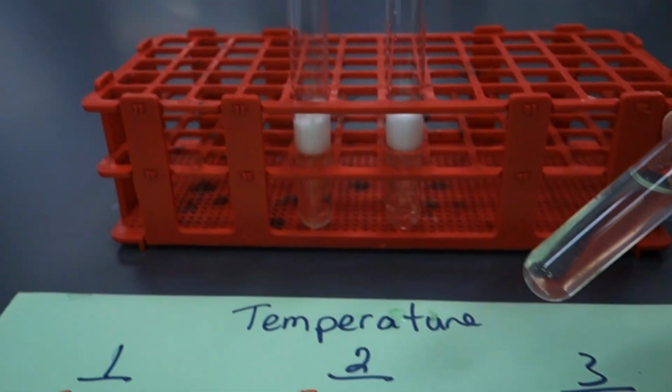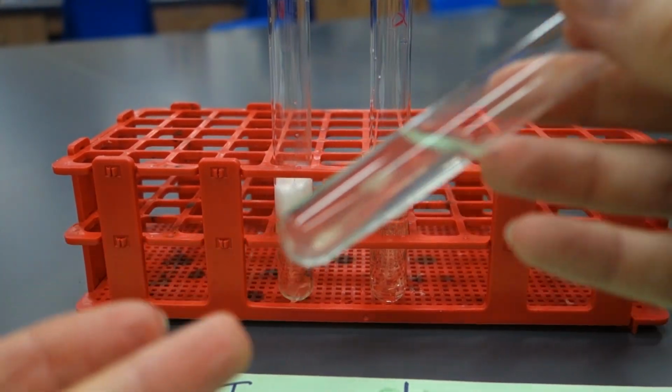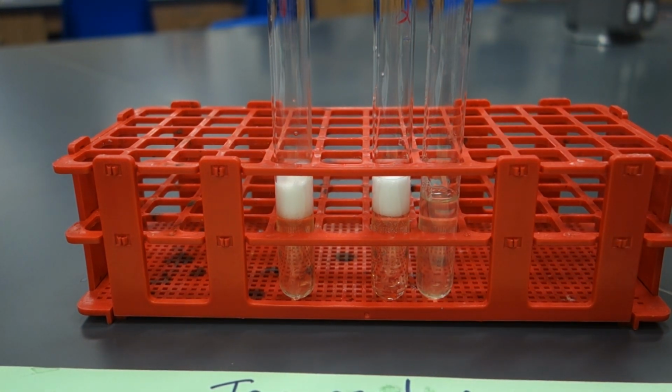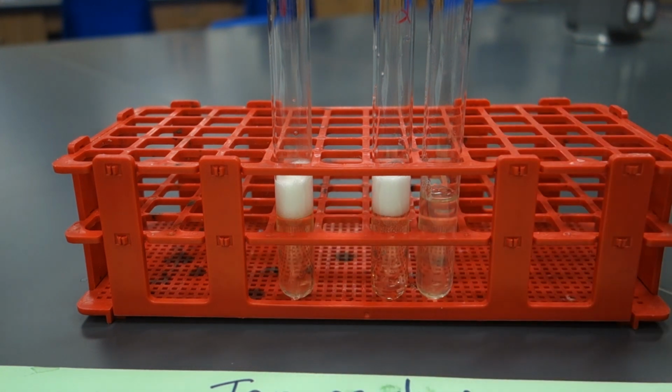So if you've got this sitting in boiling water, the structure of the enzyme physically breaks down. So remember, an enzyme is a protein, right? So it has a quaternary shape. You can denature that protein in many different ways. Boiling is one of them. So if you cook the enzyme, you break the hydrogen bonds, and that results in the enzyme not working, which we're confirming here. What we're also confirming is that potatoes actually work in 2 environments pretty well.